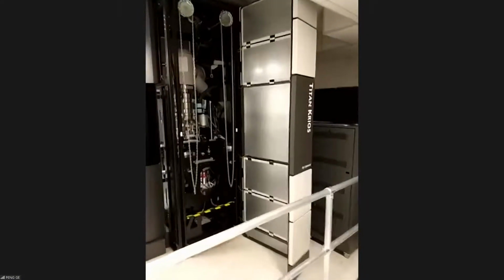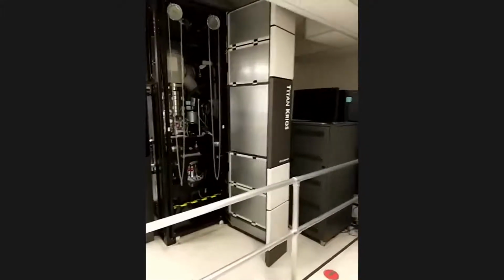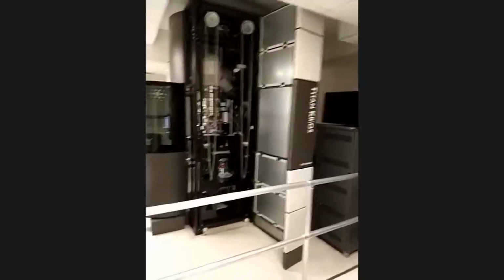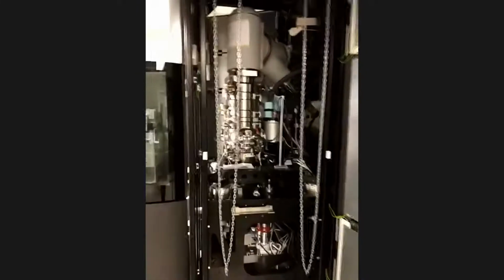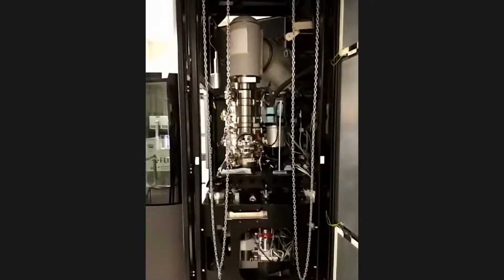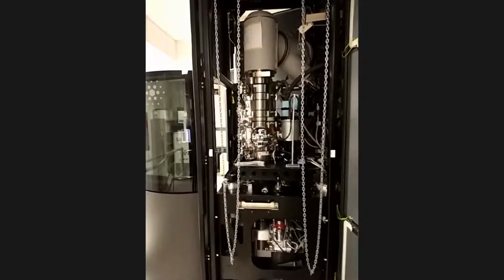Actually, this is a live running system, meaning we are running a product on it automatically without any human intervention. As you can hear, if I get close, you can hear the movement of the stage. By the way, I'm very grateful for the talk that Adam gave earlier today, in which all the 5 senses of science come together to give you a full picture.